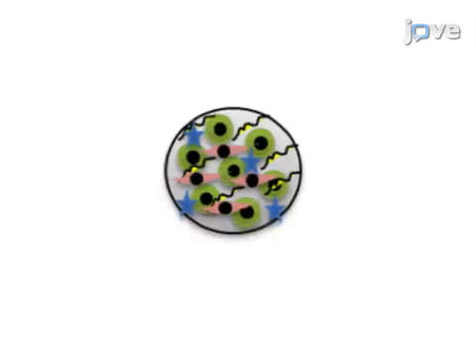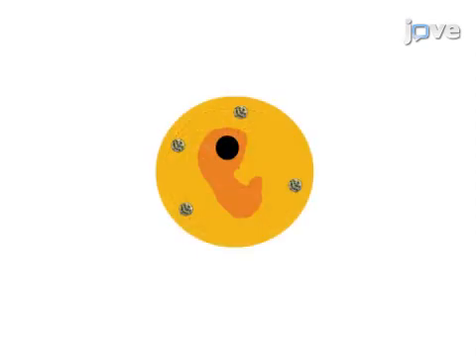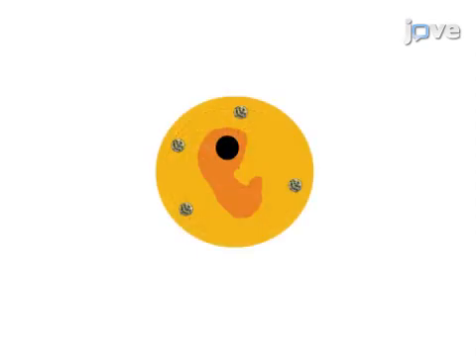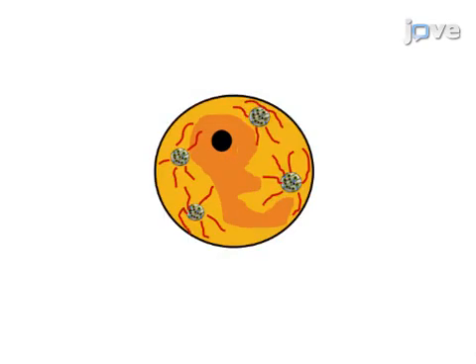Next, 3D tumor spheroids can be grown in vivo in chicken embryos in order to test the effects of novel drugs on tumor growth, invasion, and angiogenesis.